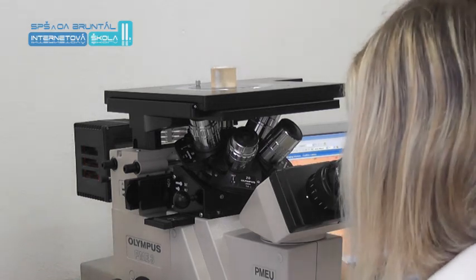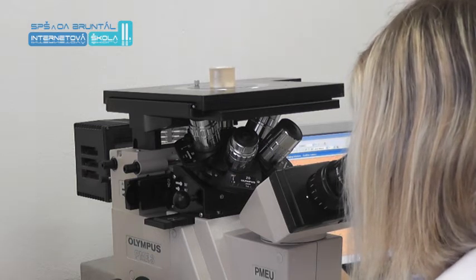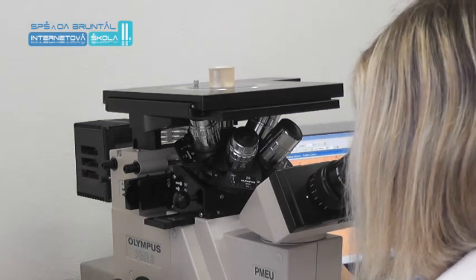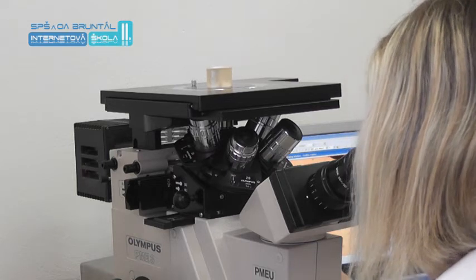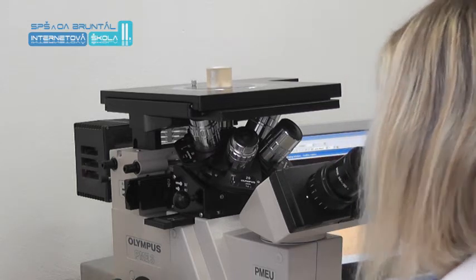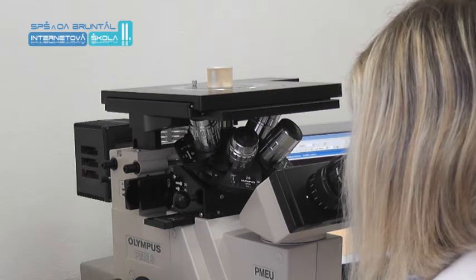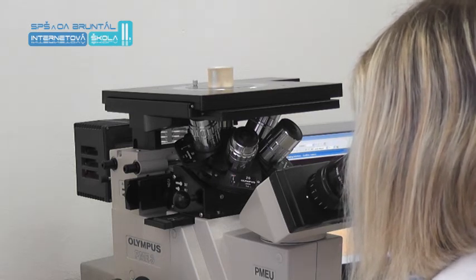Observation can thus be performed in different locations on the studied surface. The image is focused by raising or lowering the working stage. One screw is for coarse, the second for fine focusing of the structure.